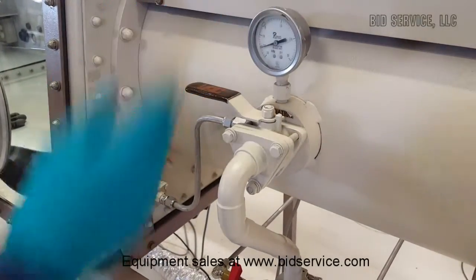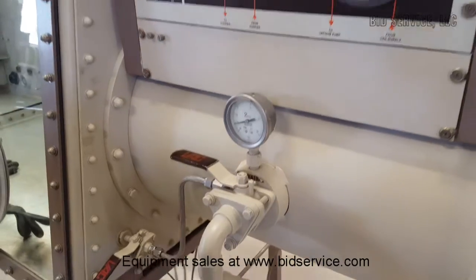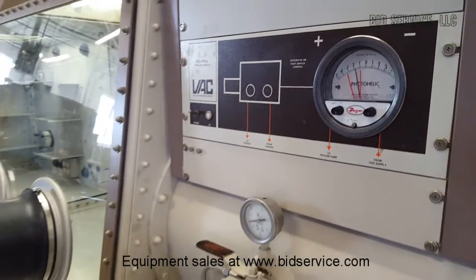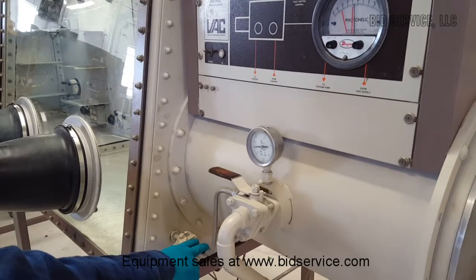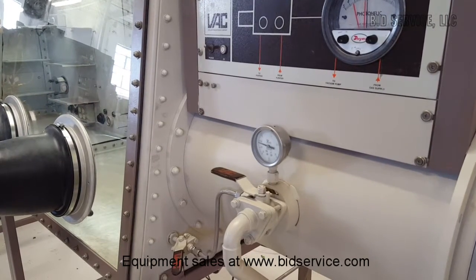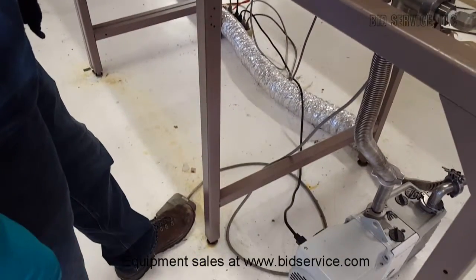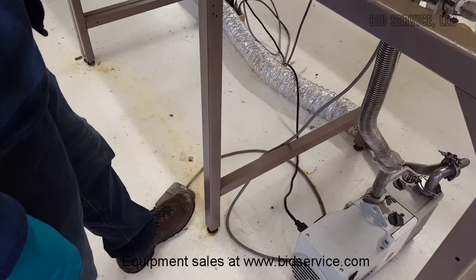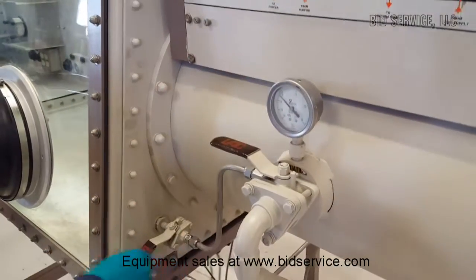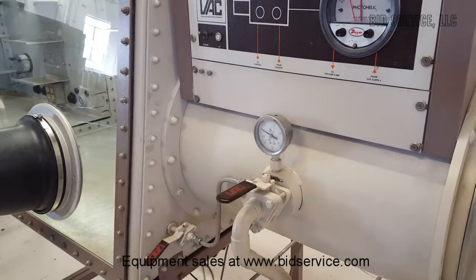It's best to keep the gloves in the box at a positive pressure — I'm at just over one. I'll add a little more gas because backfilling will draw gas out of the glove box into the antechamber. I can open this valve to backfill. I'll use the foot switch down here to add gas into the glove box to compensate for the loss. Looking at the vacuum gauge coming back up to zero — close that off and do another evacuation. Generally you do three evacuate-and-backfill cycles before opening the inner door.